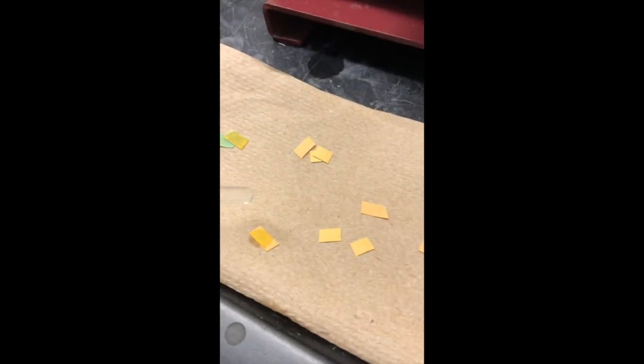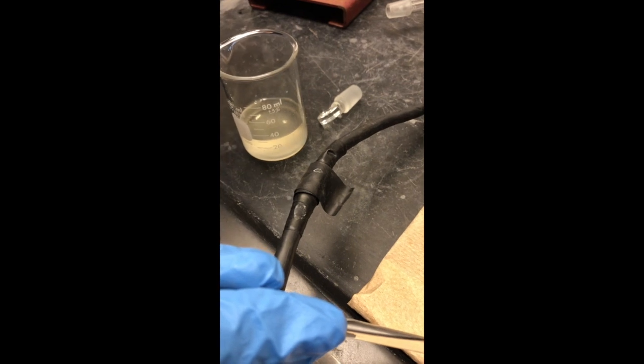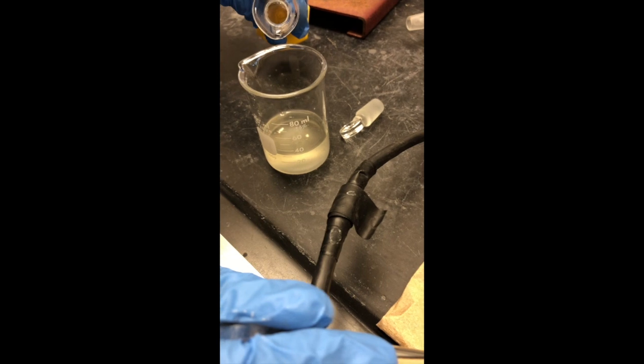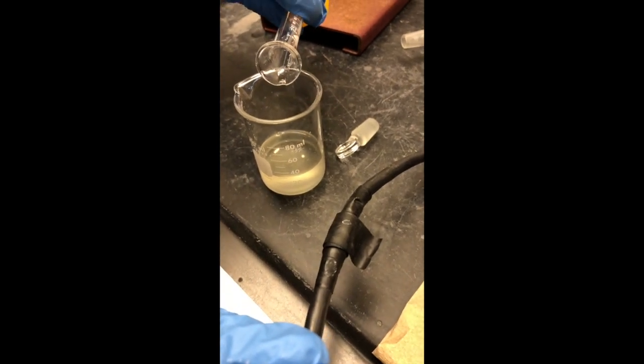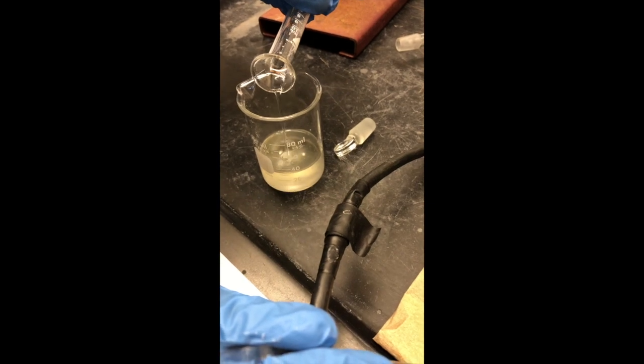It's maybe seven or eight now, but actually it's more like six — and we want it to go below four, we want it to be acidic. She's added a little more; we've added one and a half milliliters already. The pH may go back up a little because there's still some magnesium floating in there, so we'll add more acid and then fish the magnesium out.